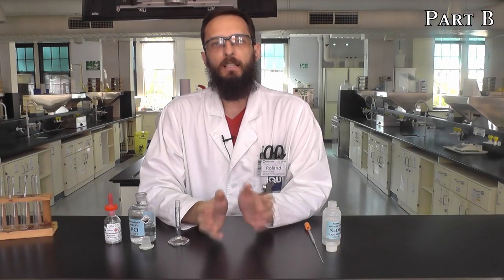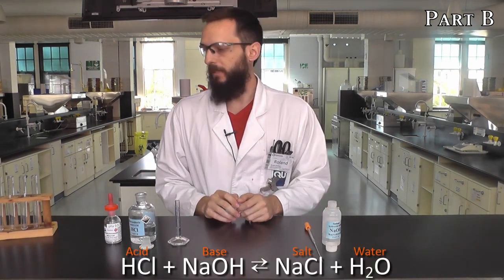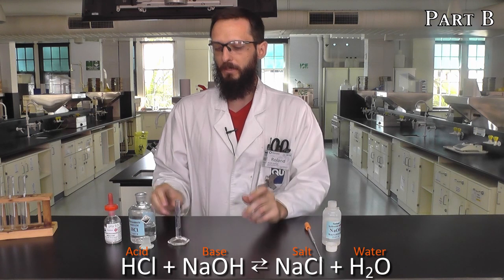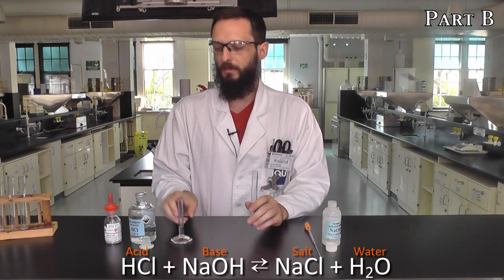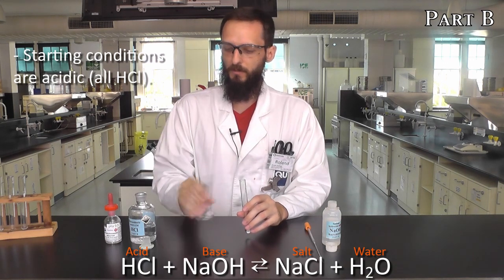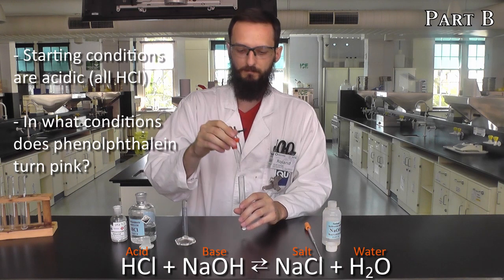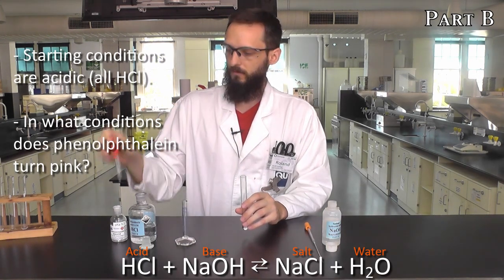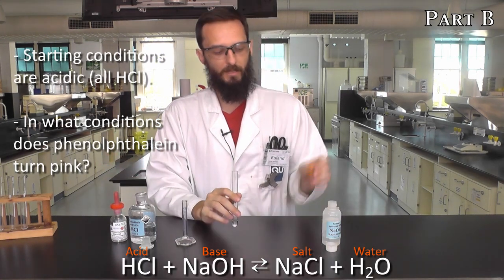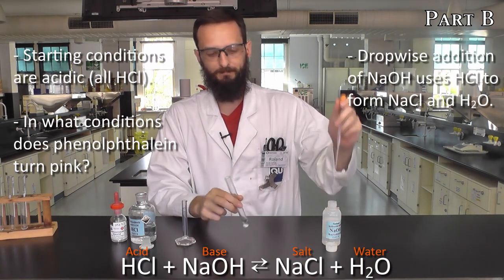What we're going to do for the last part of part B is a simple acid-base reaction between sodium hydroxide and hydrochloric acid. So in a test tube, I'll measure out 2 milliliters of hydrochloric acid, which I've done with this measuring cylinder, add it to a test tube, along with a couple of drops of our phenolphthalein indicator. And then drop-wise, I'm going to add sodium hydroxide until I notice a color change, swirling all the while.